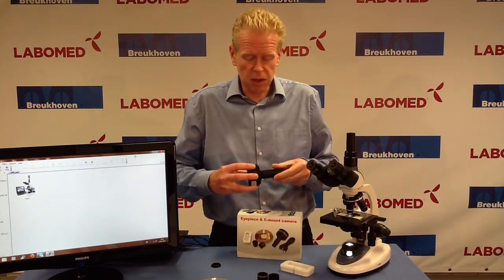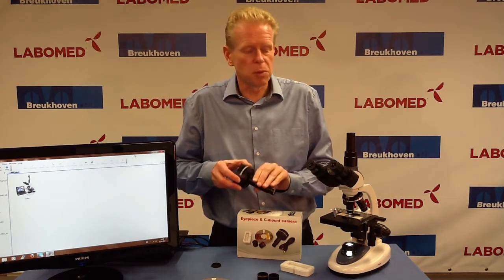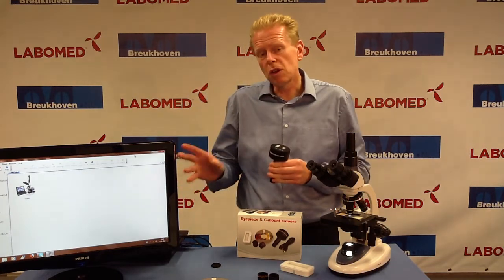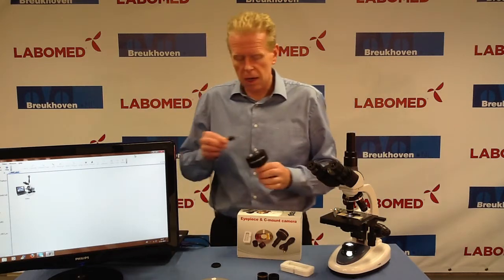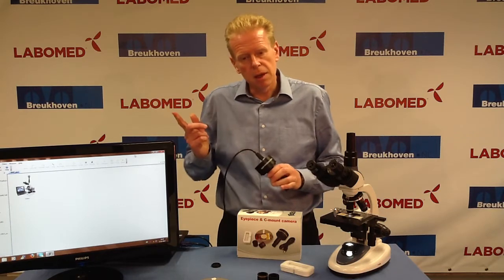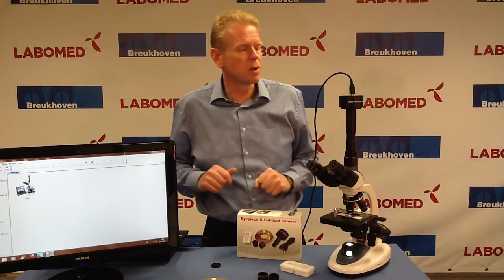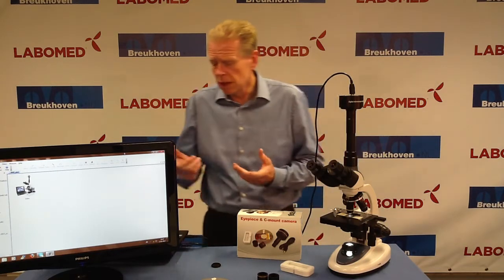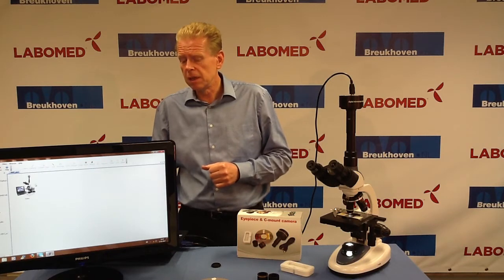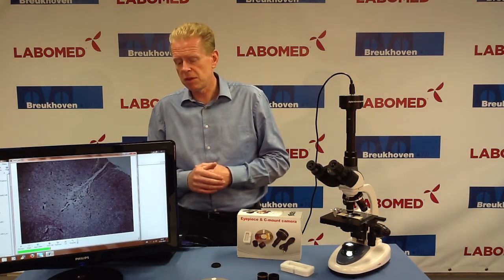In this case I am using a standard microscope, of course a BMS one, and I put on the compensation optics. I have already installed on my laptop the BMS Pix software — that is the first thing we request you to do. I connect the USB cable and I hear Windows recognizing the hardware. I put the camera on top of the microscope; you see how easily it just slides in. The only thing I now have to do is select in the software the icon to grab images, then double click on it, and you see that the live image is directly there.